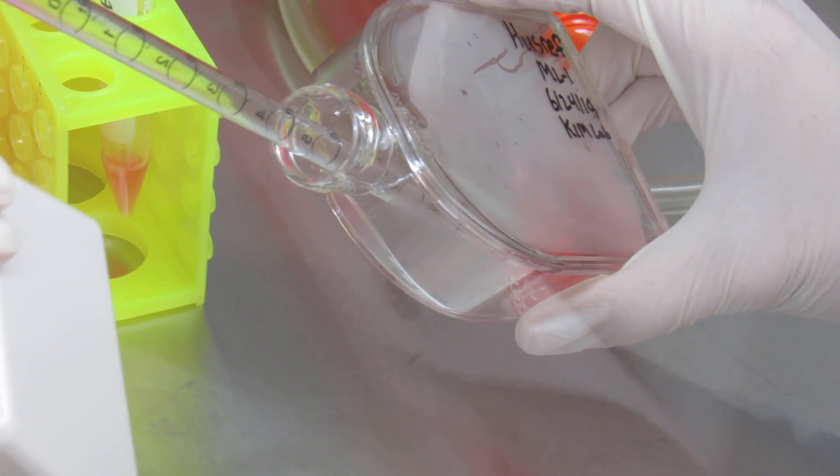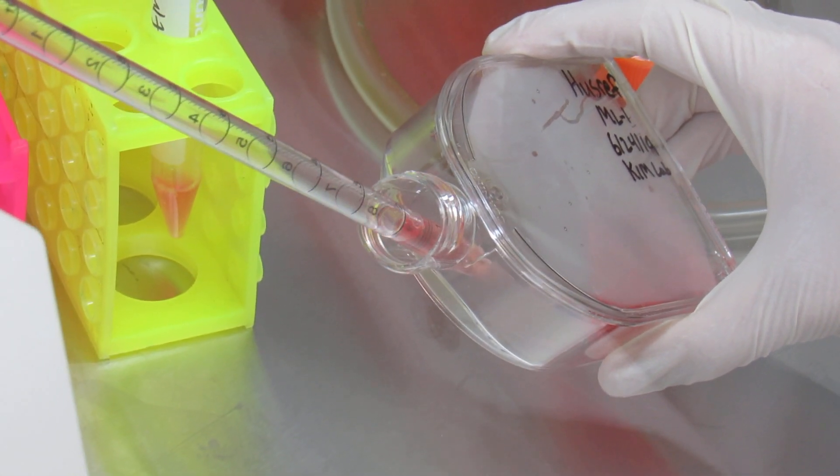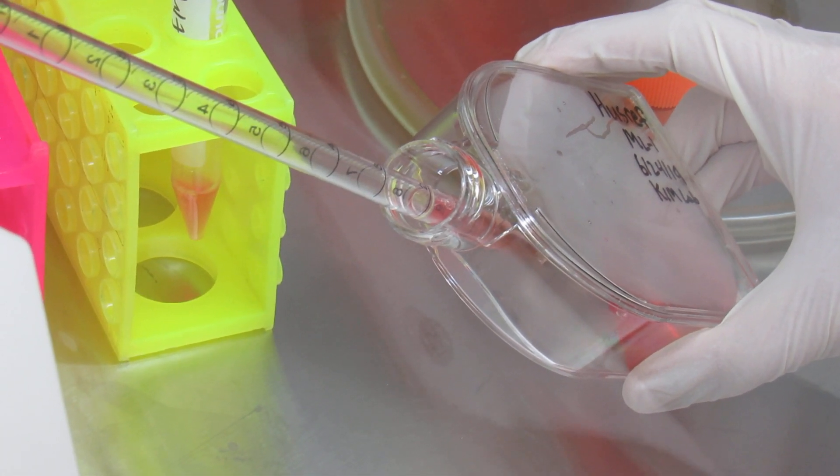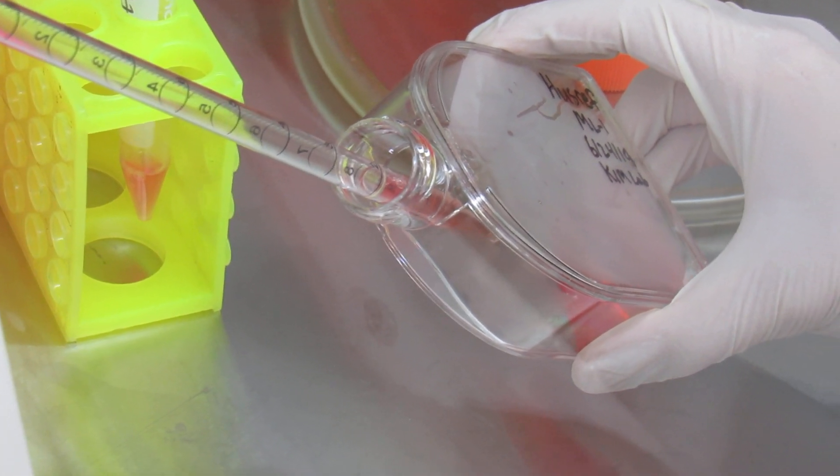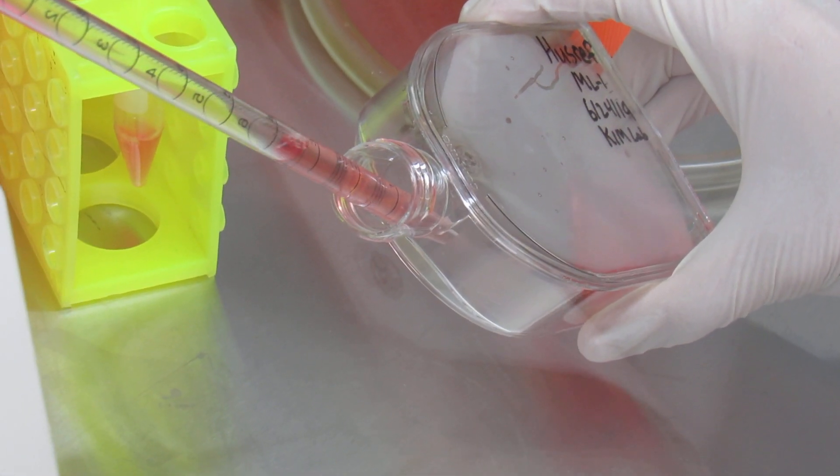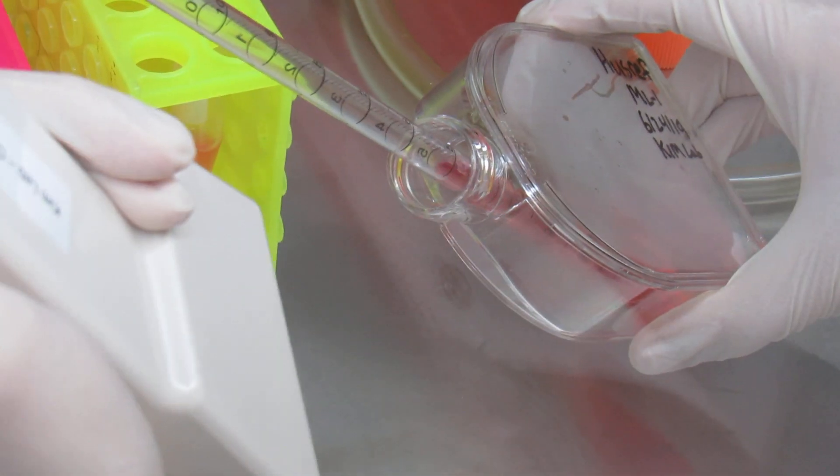So now you'll suck up a little bit and then you'll shoot them out pretty quickly. It is important to know, however, if you completely expel all of the contents from the pipette, you will create a lot of bubbles. So what you want to do is not shoot out everything every single time. If it happens, that's okay, but you want to avoid that as much as you can.